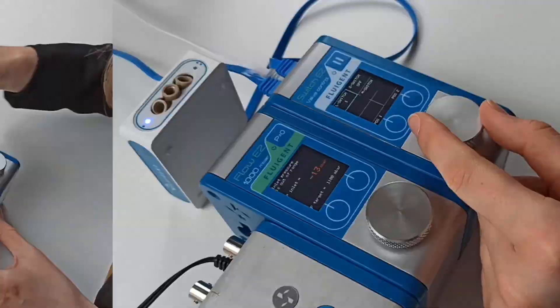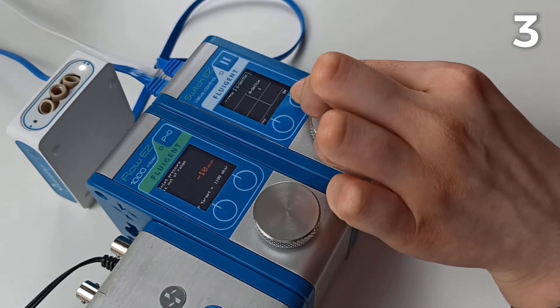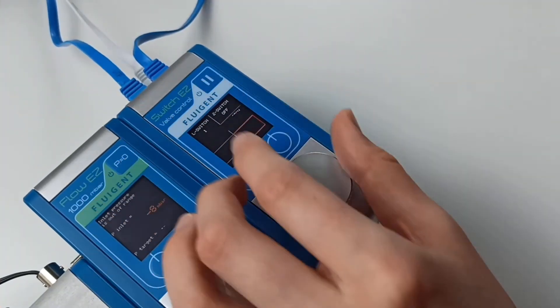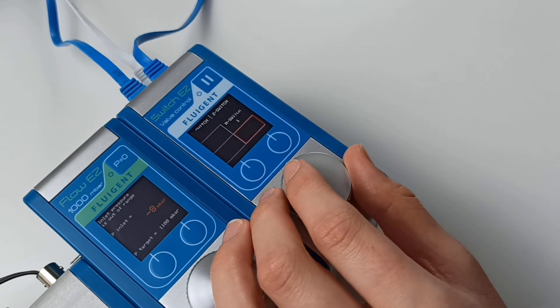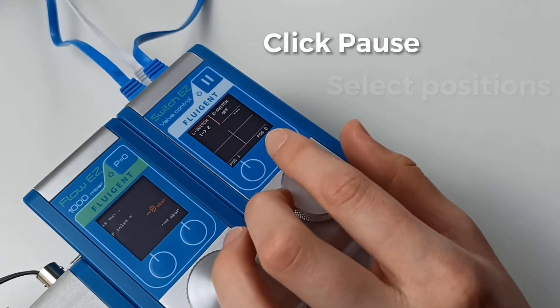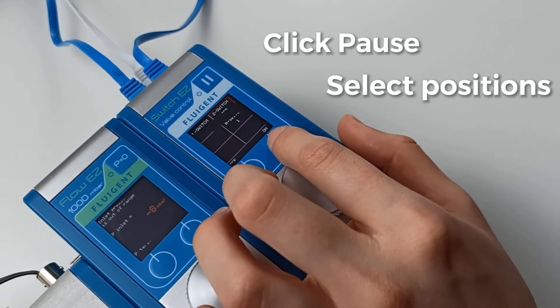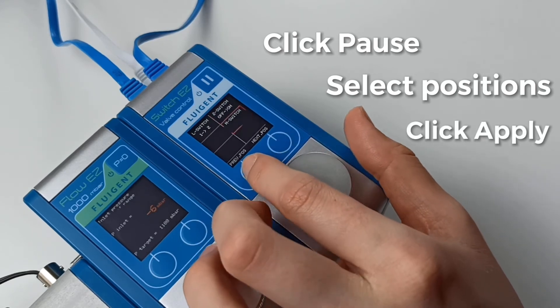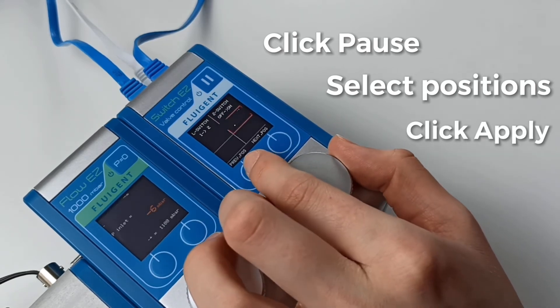For manual control, choose the valve you would like to actuate. You can also decide to actuate all connected valves at once by clicking the pause button, selecting the positions, and sending the orders by clicking again. It is quick, simple, and accurate.